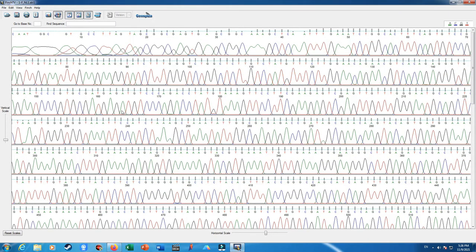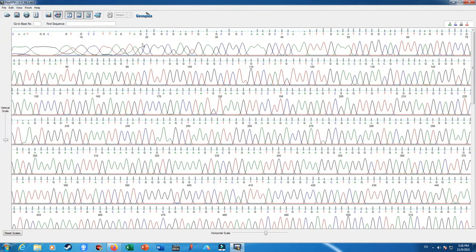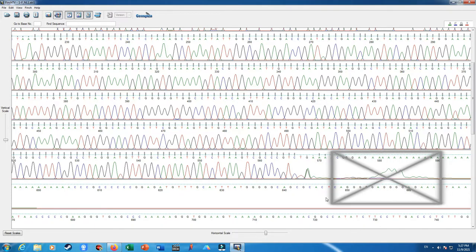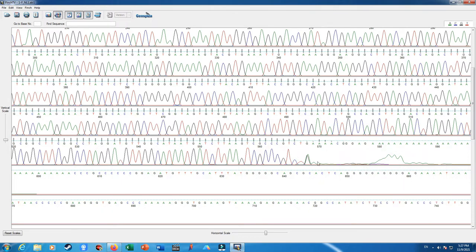Okay, in the first 18 to 20 stretch of nucleotides, we will see some non-symmetric, poorly separated peaks of our nucleotides. This results from high quantities of our fluorescent free dye, which may mask the exact nucleotide stretch. We will ignore the first stretch of our sequencing. Also at the end of the sequencing, we have a relatively low amount of free dye fluorescence, which is overlapped with our nucleotides. So ignore or discard this stretch of nucleotides at the end of the sequencing results.